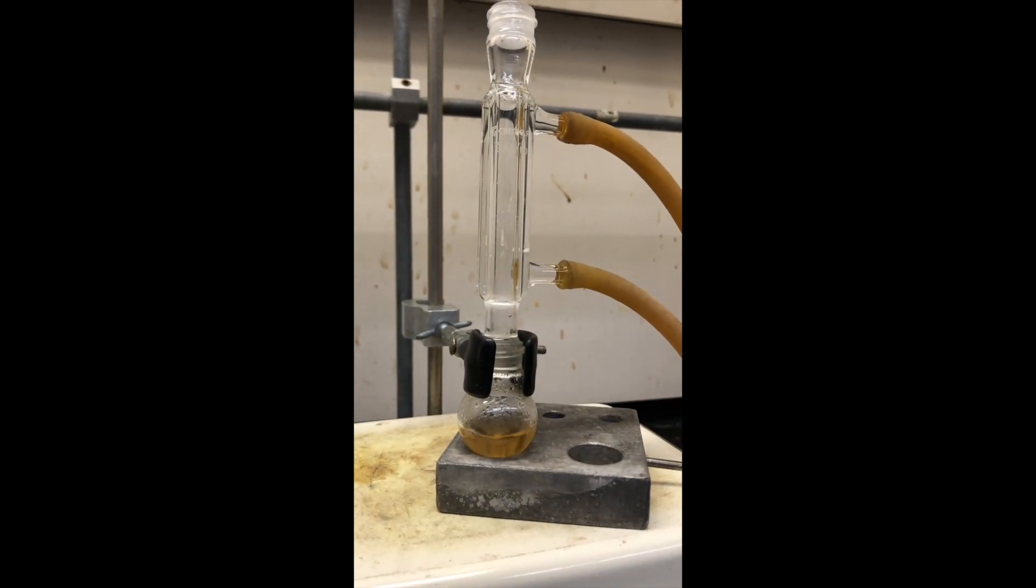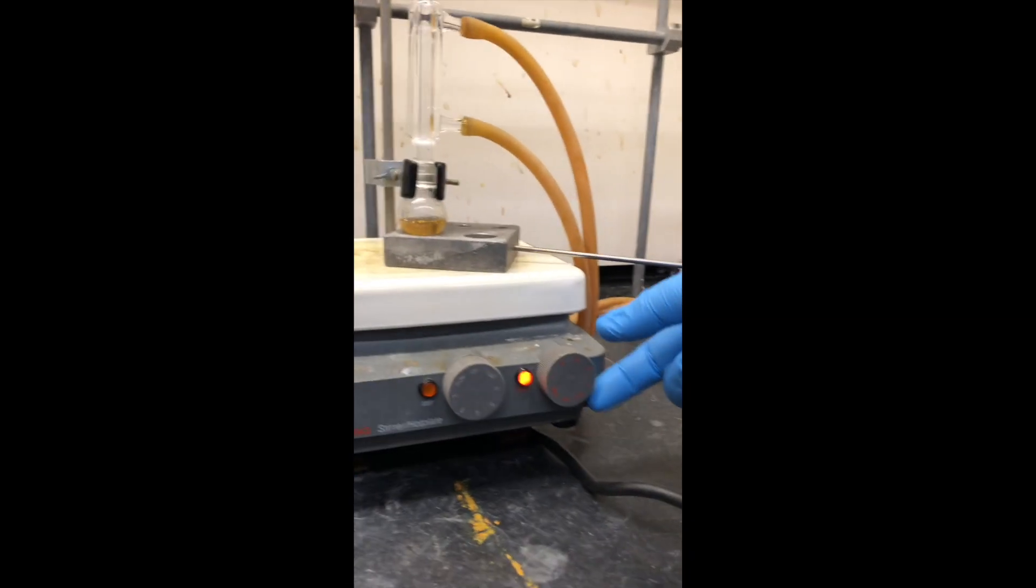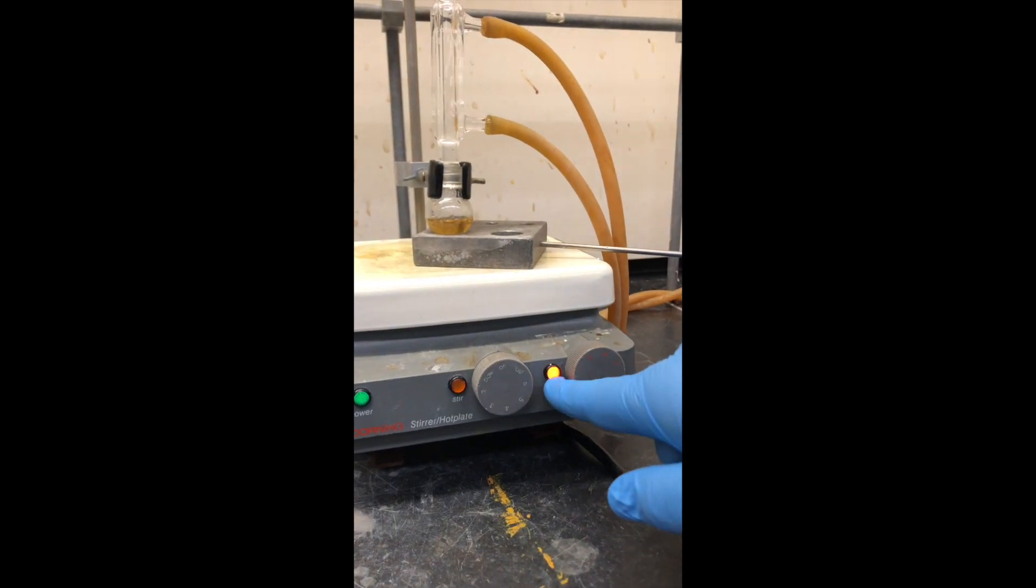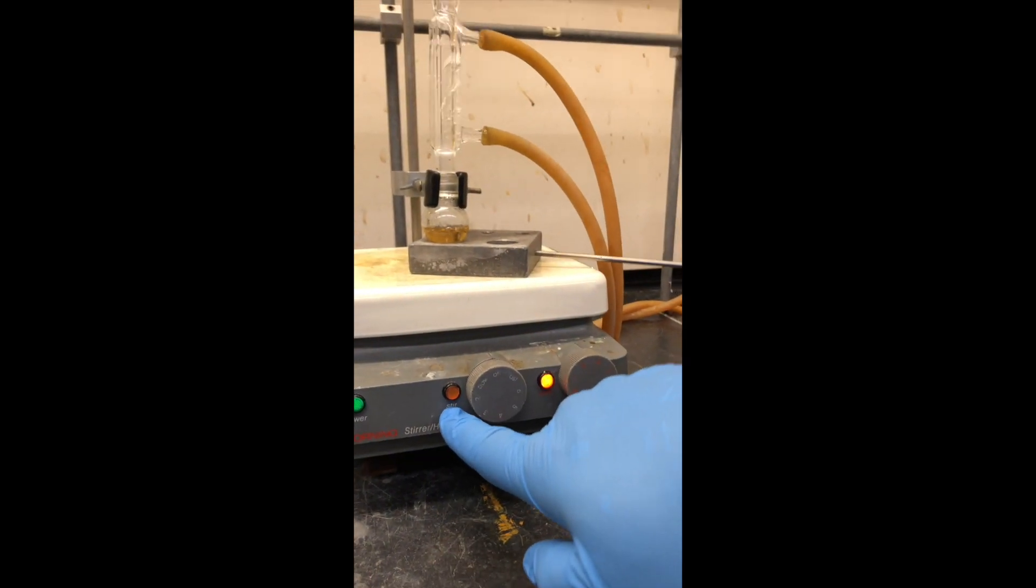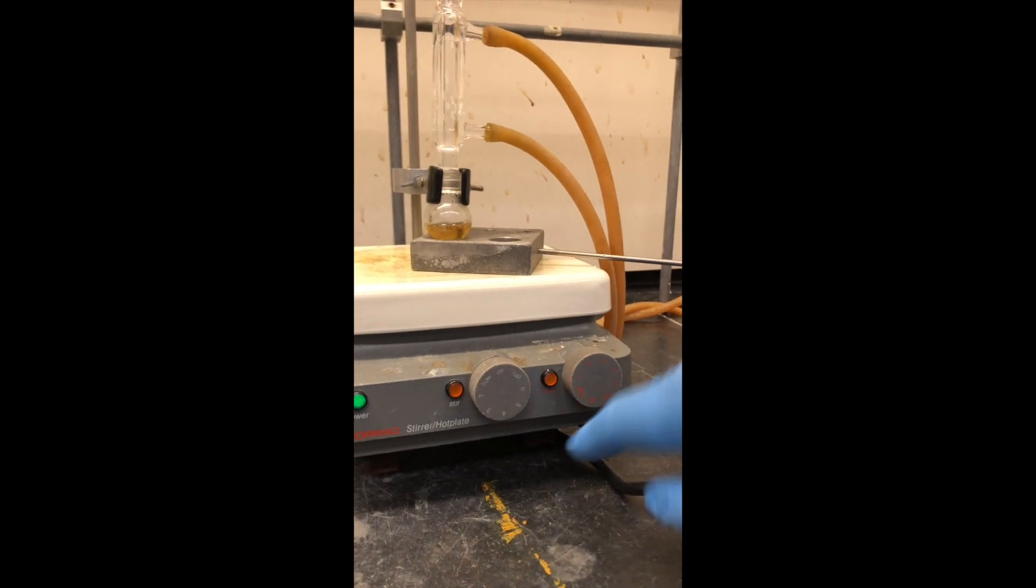You'll also notice that on the stir plate hot plate, we have now the heat turned on. In the prior video we had the stir only turned on which is not going to do anything to heat your reaction mixture so we have now the correct side turned on.